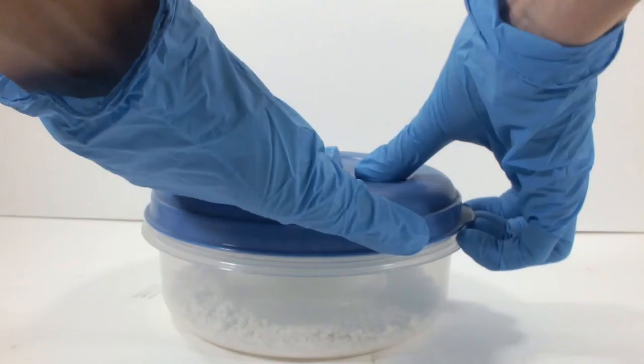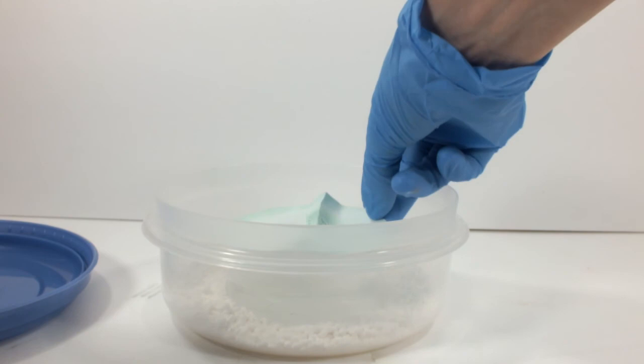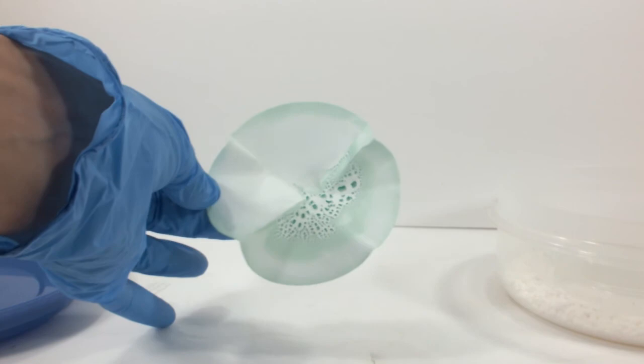Alright, after some time drying, let's check in on our new complex. Well there's not much, but it is a distinct color, so we made something.